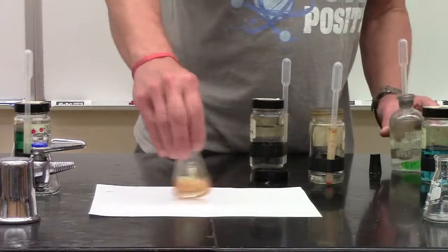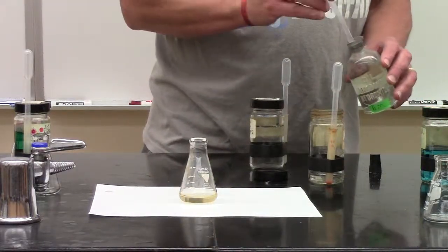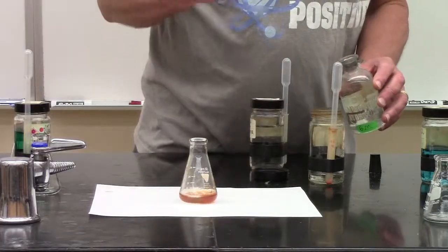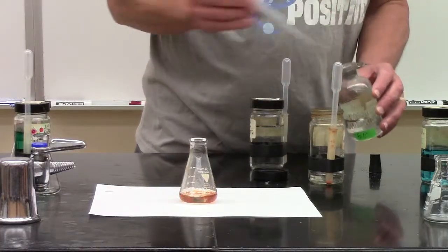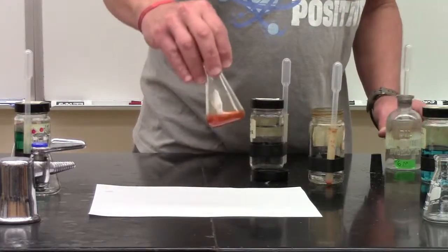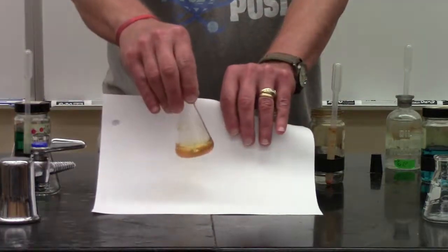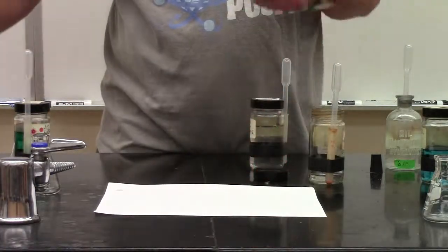Oh, there you go, kind of orangey. What are you putting in that? A little ammonia again. Iron rust really is just iron hydroxide that's wet, so it has that orangey color, which is kind of related to the yellow one. Okay.